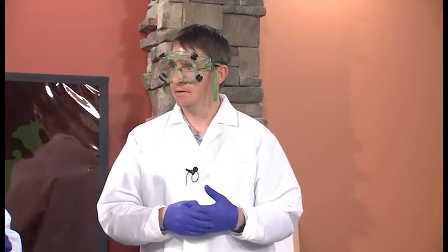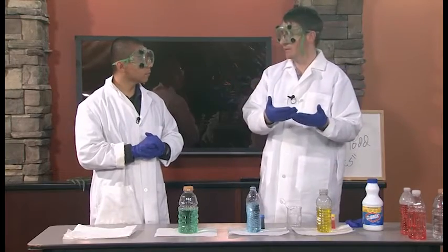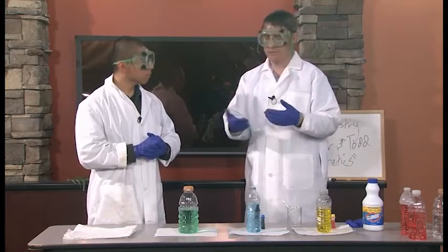What are we looking for to let us know that the reaction is over, though? So when I add the bleach, how would I know the reaction's done? In other words, would they go colorless? Yeah, they go colorless, exactly. So we know the bleach is going to react with the food dye and render it colorless. Okay. So that's what we're essentially looking for, is to either time it specifically, like watch the clock, or just kind of get a feel for, this took about 10 seconds and this took maybe 2 minutes or 10 minutes.